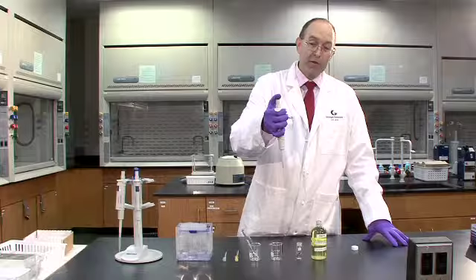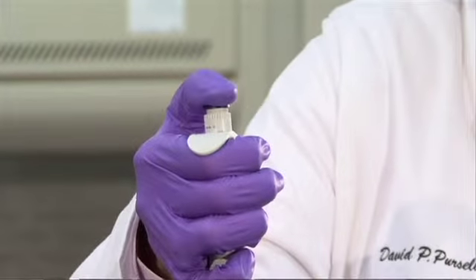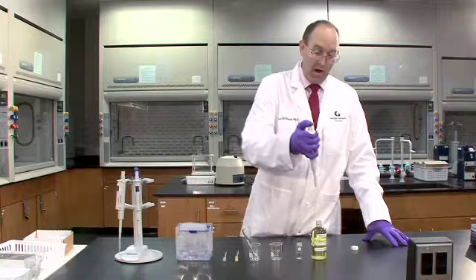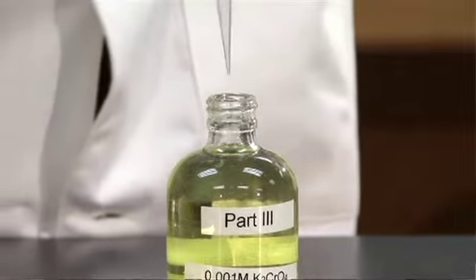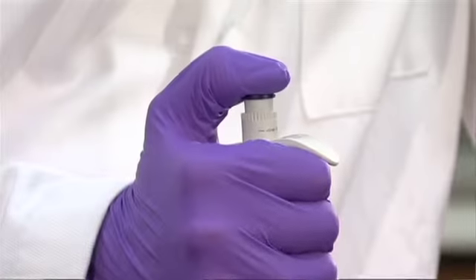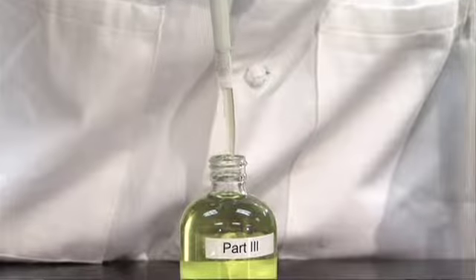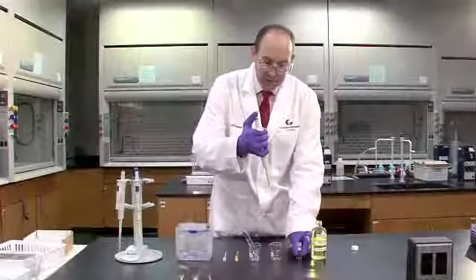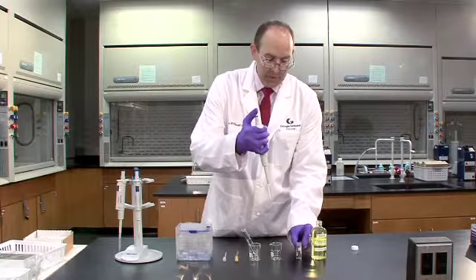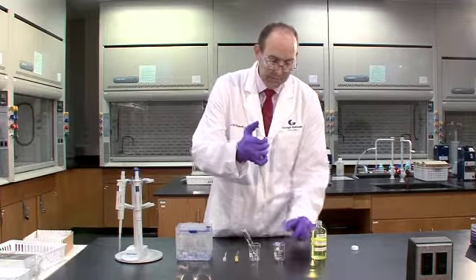So in order to draw the liquid up, first I'll depress the thumb detent on the pipette. I'll move the ADP over the reagent bottle and submerge the tip into the liquid. I will then slowly raise the detent, and as you can see, I have drawn up exactly 1 milliliter of reagent into the ADP. I'm going to put it into this conical vial, and recall that we always like to support our conical vials in beakers.